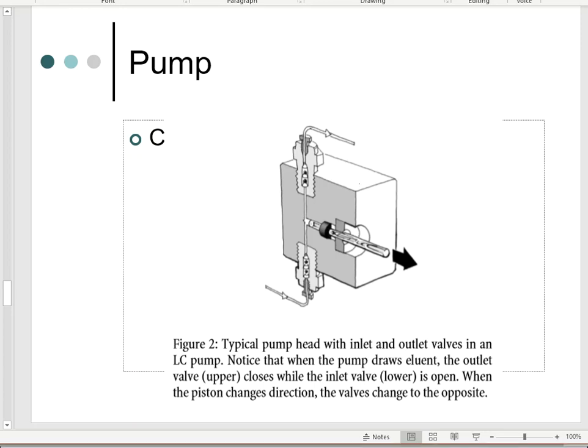So basically what you're seeing in this picture is this piece of tubing up here at the top. Think of the eluent coming in on the inside of your mobile phase and going through and out the other end. So I think I've drawn that a little backwards. This top one is going to be the eluent coming out, and this bottom one is your eluent coming in. So this is going to have some sucking action, right? Your liquid's going to come through that tubing that they disconnected in the last video. That was the bottom screw that they took off and capped. And then it's going to go through the pump, up through the center, and come out the other end, and it will go on to maybe your guard column or your column in the next step.